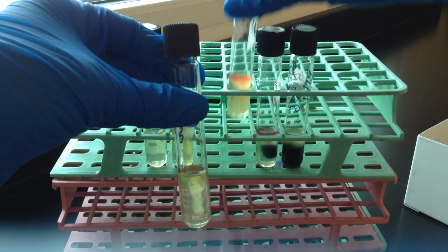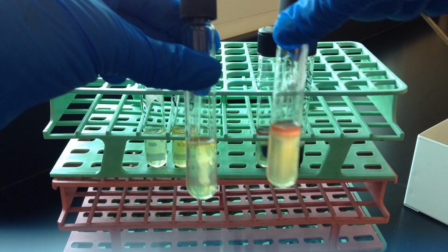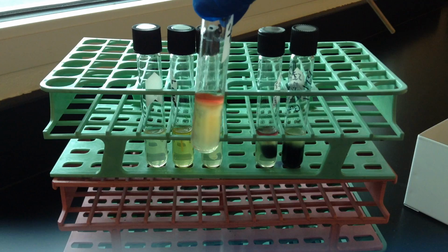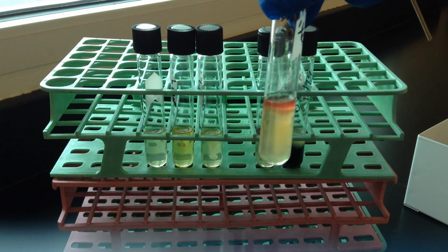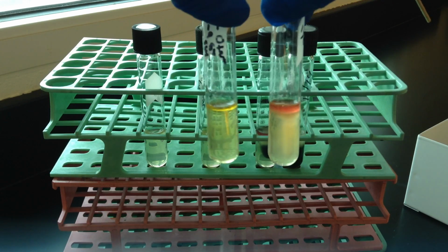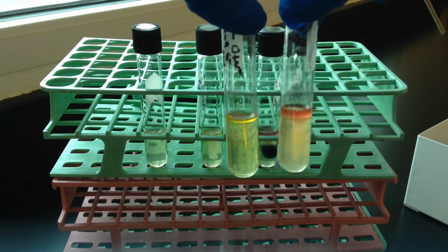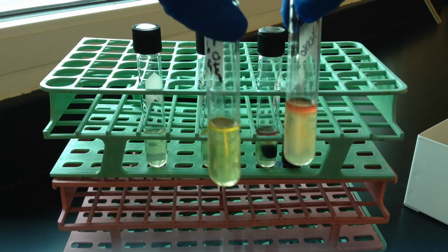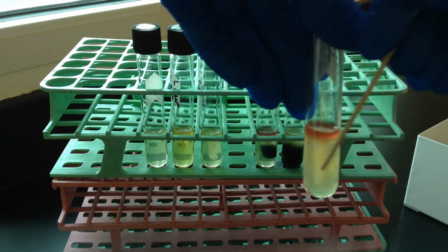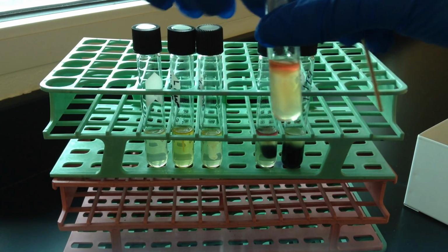So let's compare that to an organism that is motile. So this one I'm holding up here, I can see this cloudiness in all directions. And so let me compare it to a couple of examples, and that comparison can really help in the beginning when you're trying to sort this out. So there is a stab line in this tube, in the middle, but it is fuzzy and cloudy in all directions as you move away.